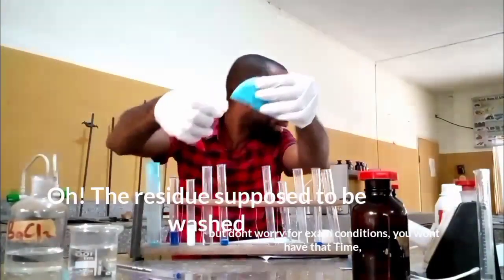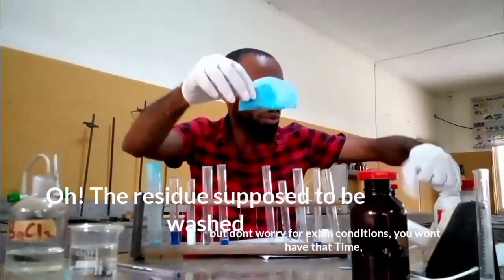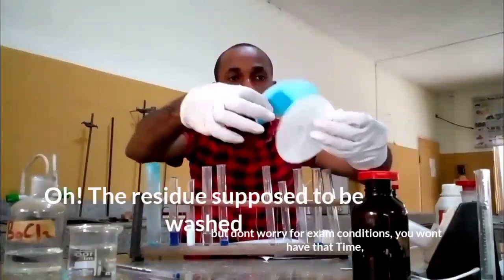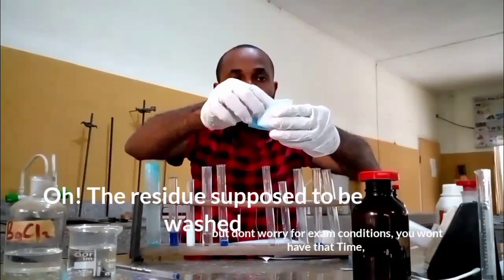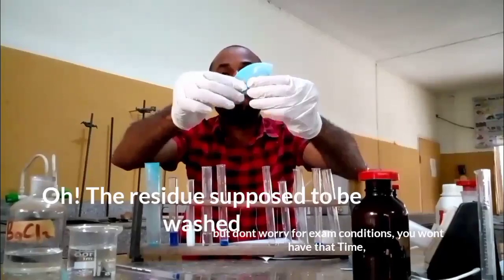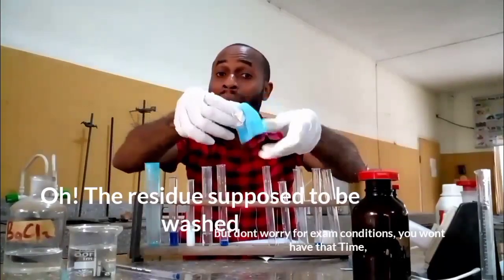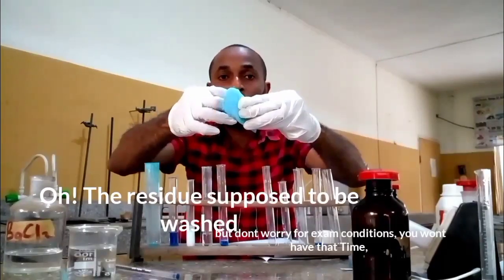Now for us to make this work faster, we need to bring a filter paper close. We need to bring a filter paper again, and we are going to join. Watch what I did. Join like this. What we are trying to do is let the filter paper absorb the water, as in the previous one. Then I'm done with this one, I'm going to throw it out. Therefore, you can ask your teacher to give you extra filter paper for this.